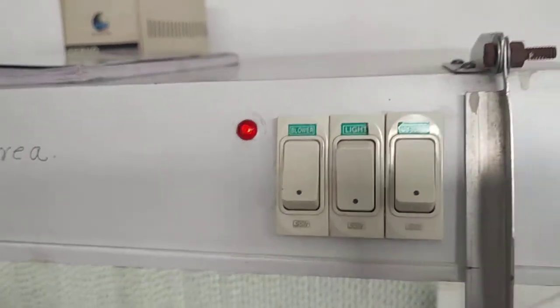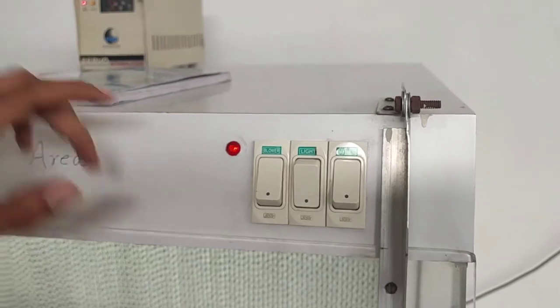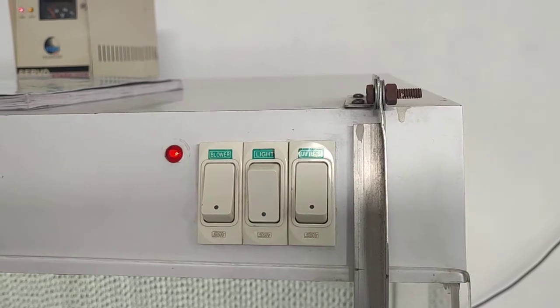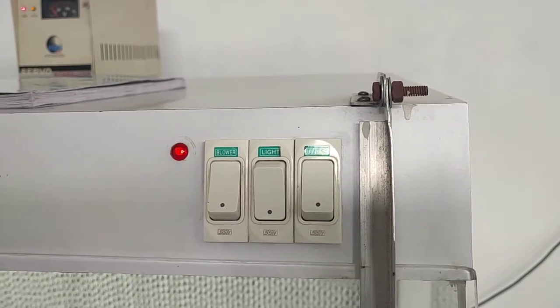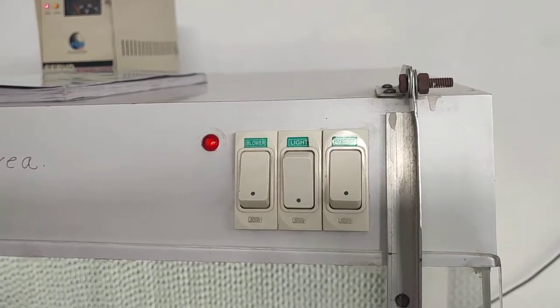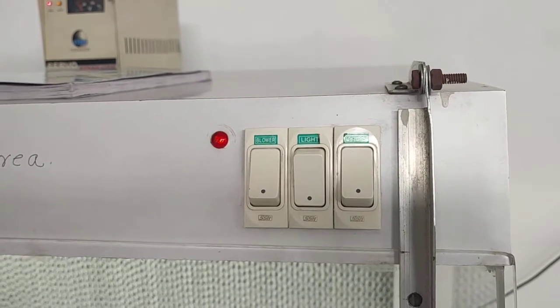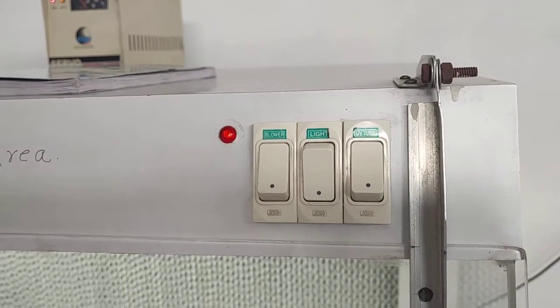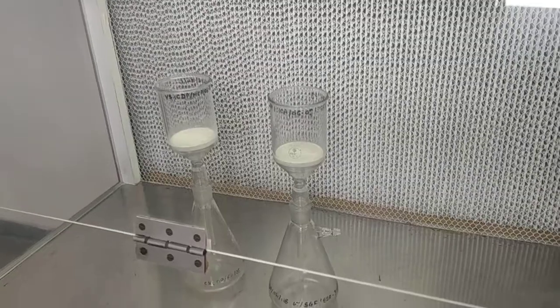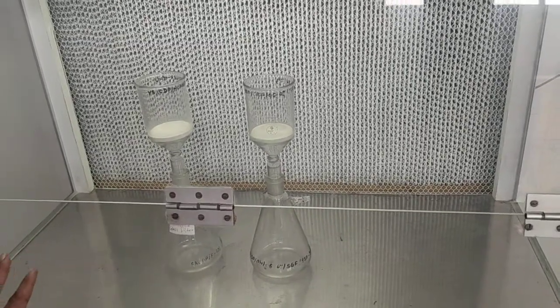The aseptic area is the laminar air flow unit. As discussed in the first practical, we start the UV tube for 15 minutes to sterilize the unit. After 15 minutes we close the UV tube, because UV light is harmful to skin. Be sure the UV tube is closed when working in the laminar air flow unit. The laminar air flow unit helps maintain an aseptic area for filtration.